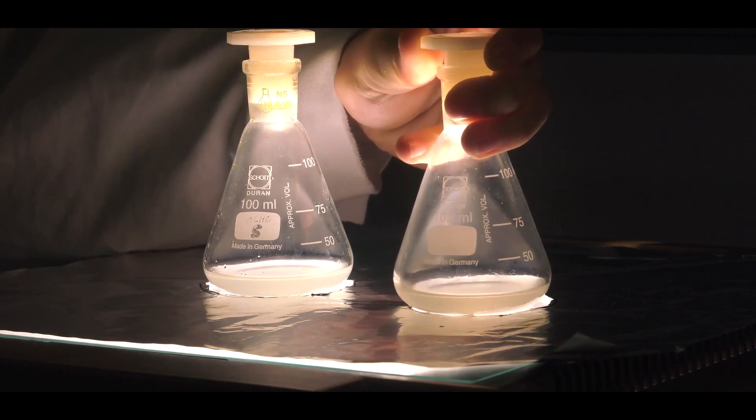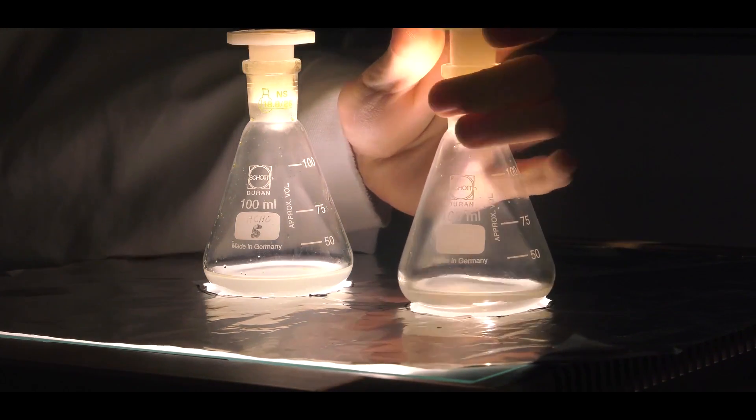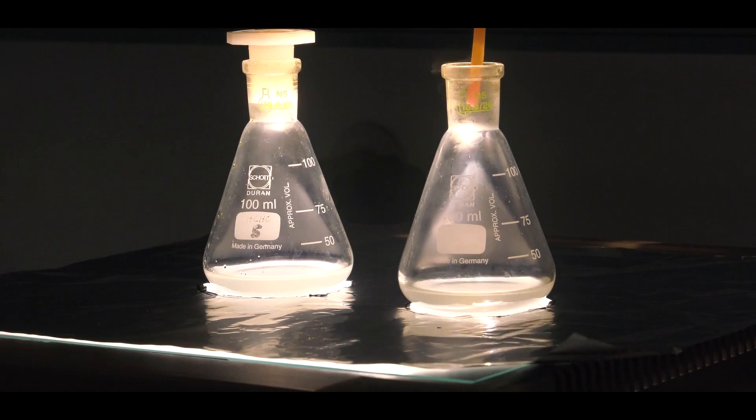Furthermore, the synthesis of hydrobromic acid can be detected with the help of a pH indicator. The pH indicator will turn red since the ascending white fumes react as an acid agent.